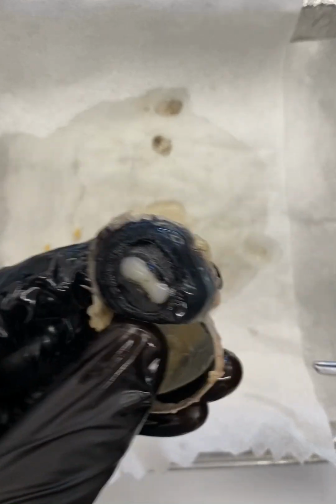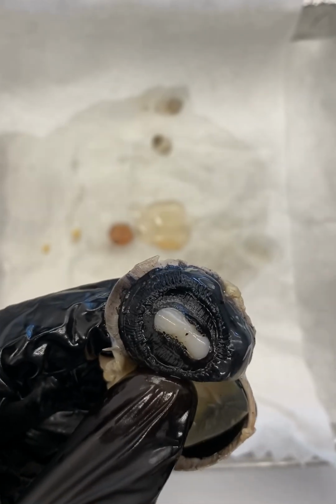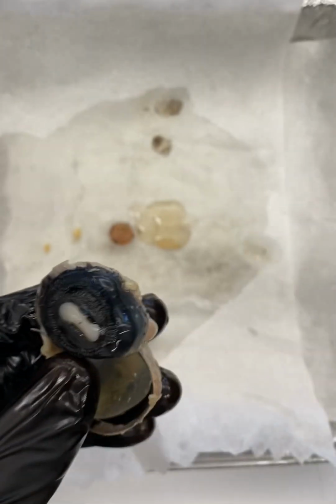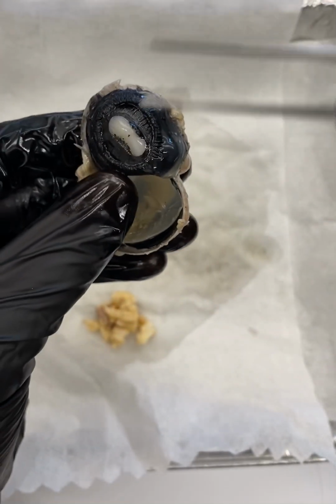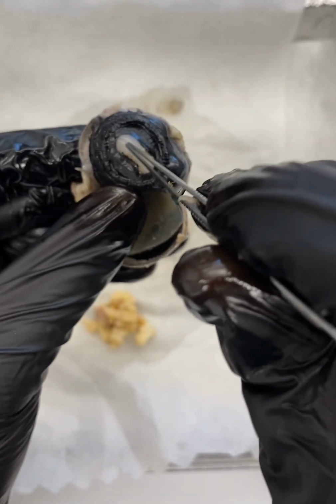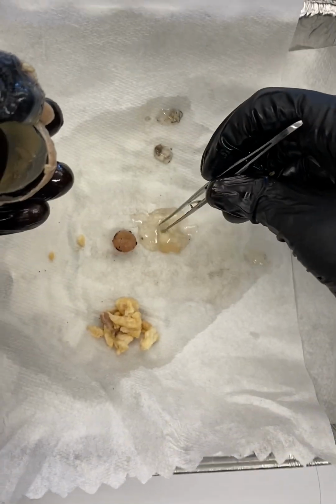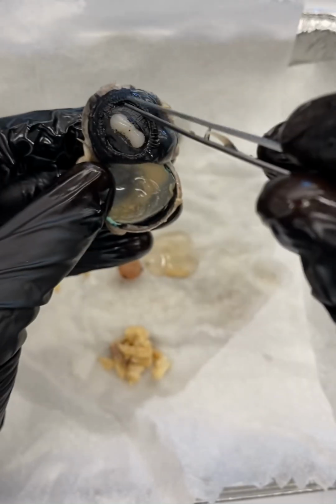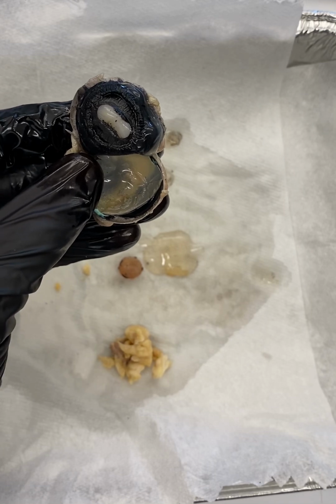So the ciliary body contains several different things, okay? One thing it's going to contain is something called ciliary processes, right? And ciliary processes produce and secrete a type of fluid called aqueous humor, okay? And aqueous humor fills this anterior chamber of the eye, right? So remember the vitreous humor, all this gelatinous material, is in this posterior part of the eye. What's called aqueous humor is more in the anterior part of the eye, okay?